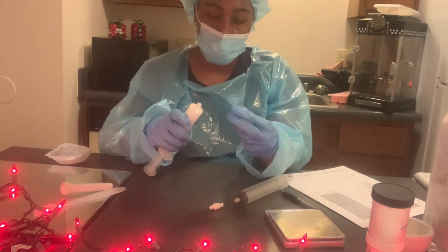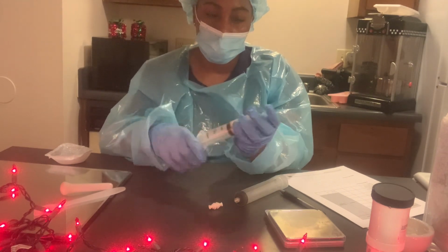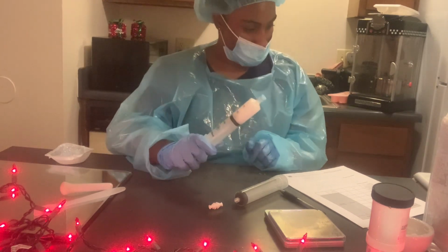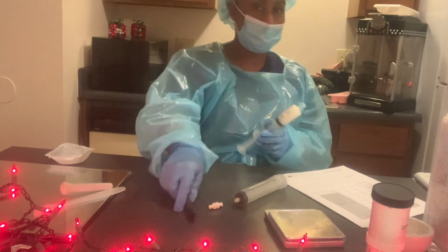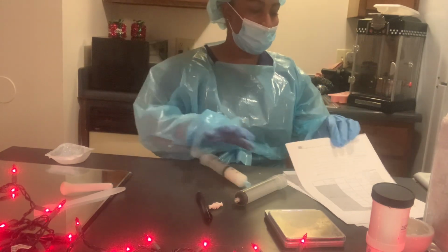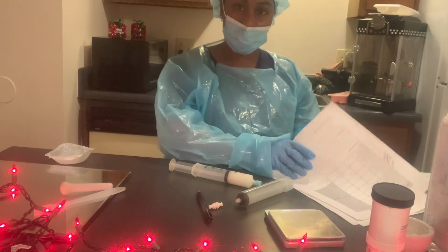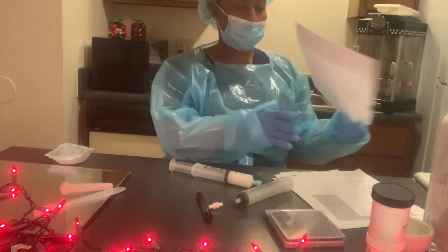And then this goes on to lock it in place right here. So attach the syringe tip to the completed prescription syringe. That's what we did. Package and label the prescription. Use the provided labels. So early in the video, I showed you guys the prescription labels, which are these again.